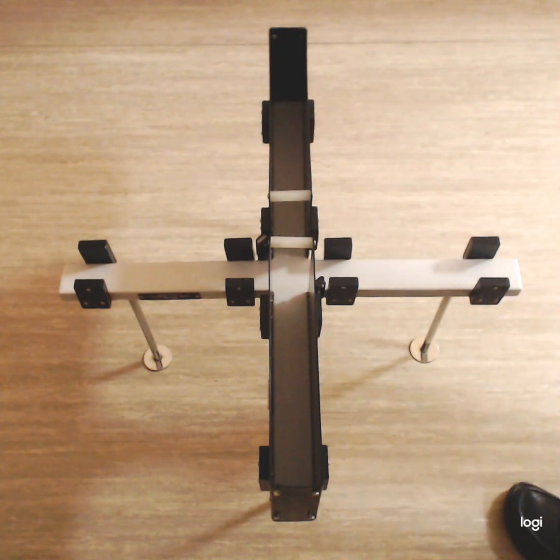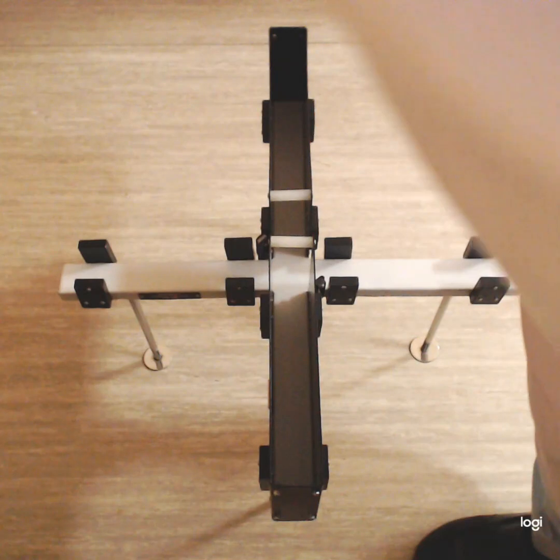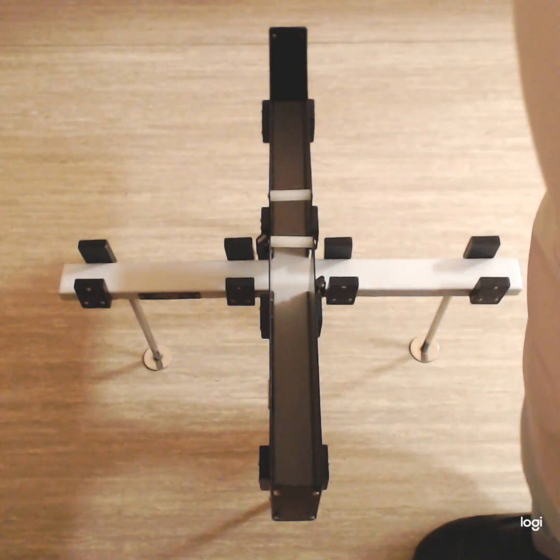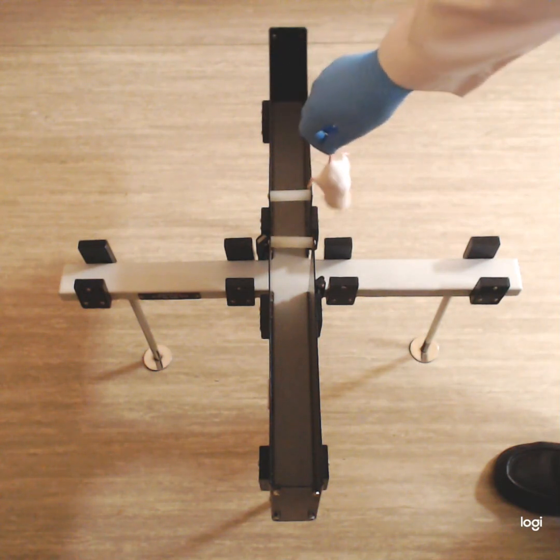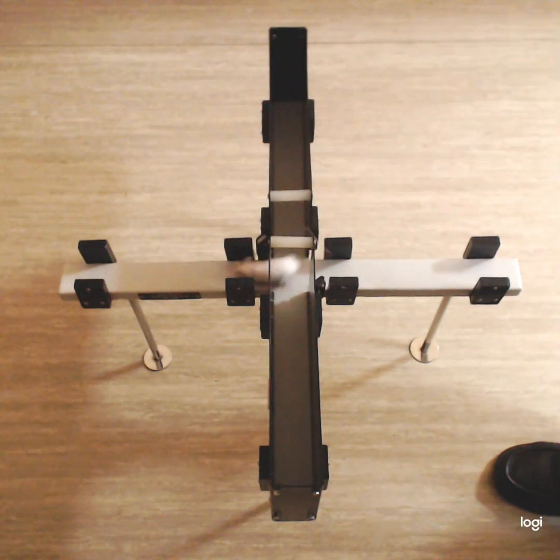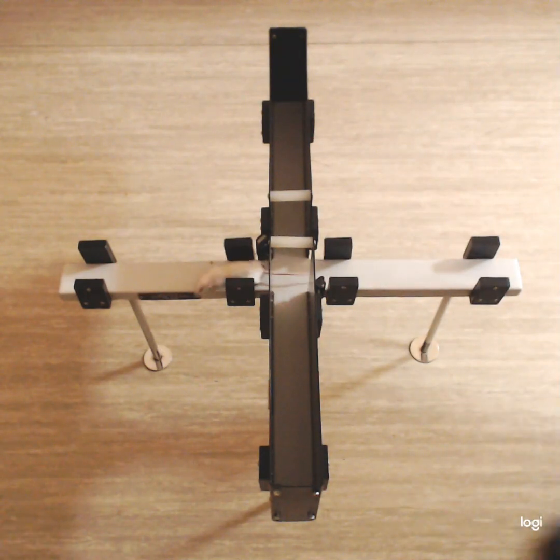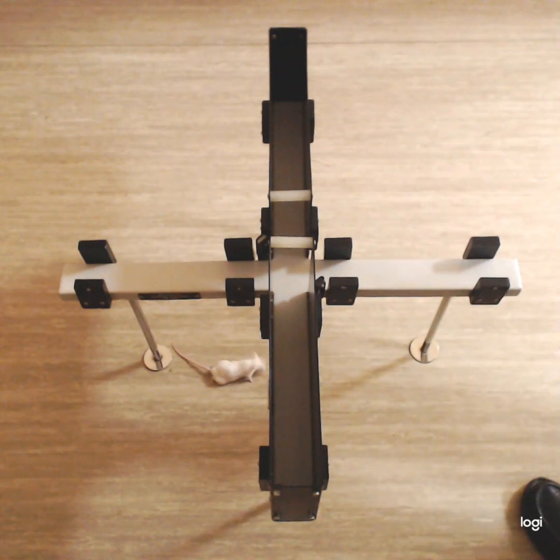Okay, now I will show you how to place the animal in the central platform. Okay, gently, and the time starts. The test time for this particular experiment is 5 minutes.